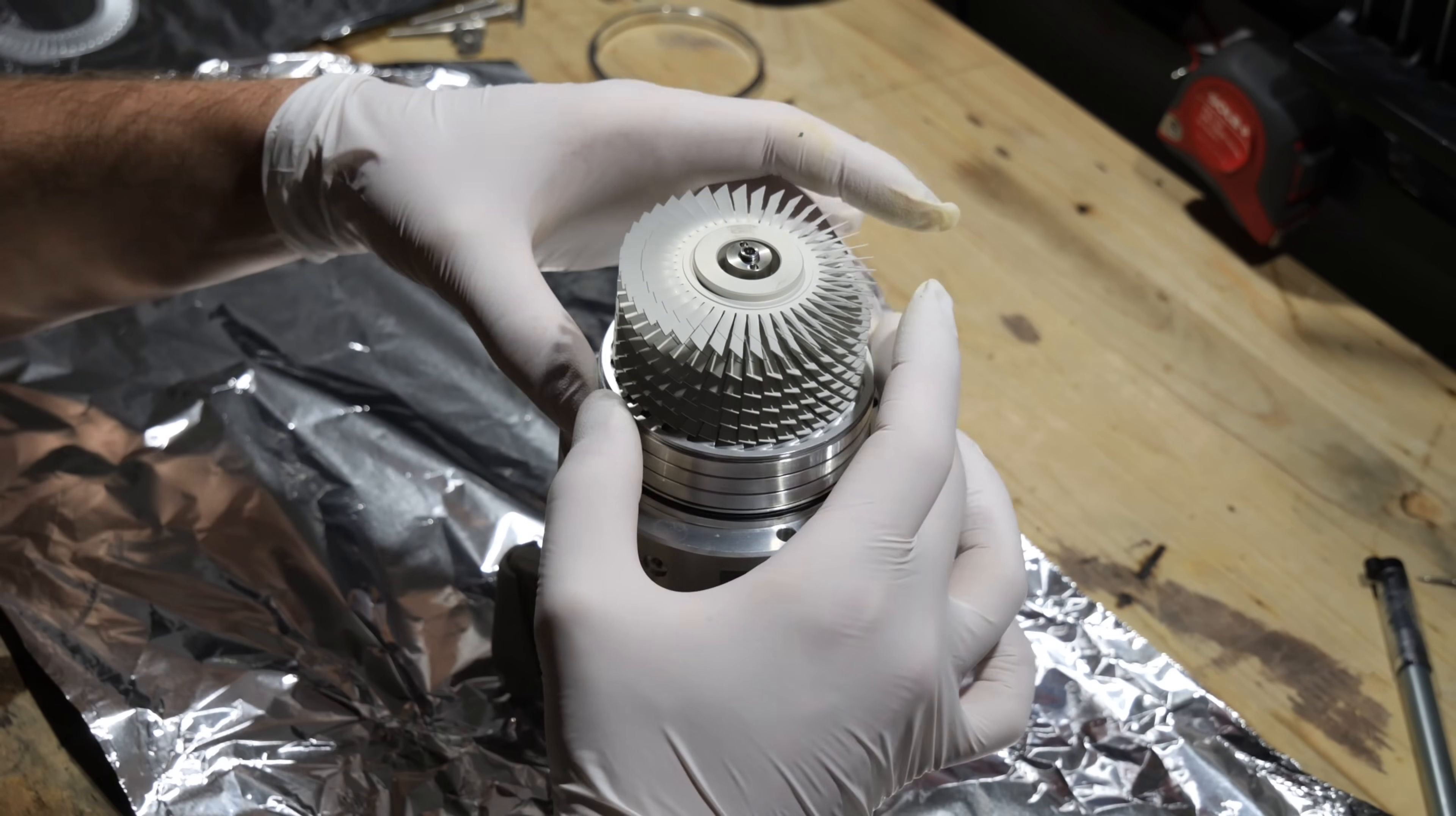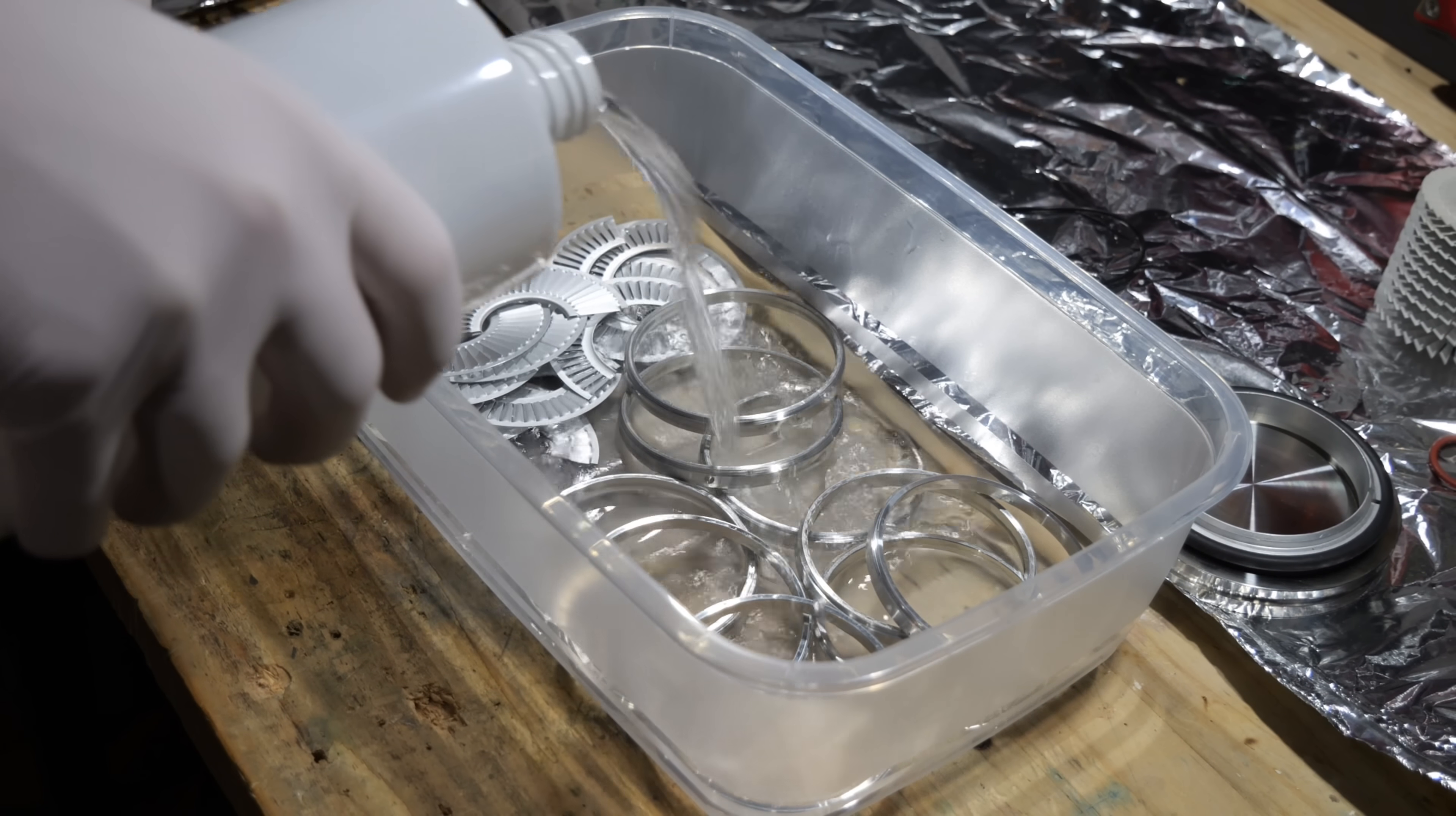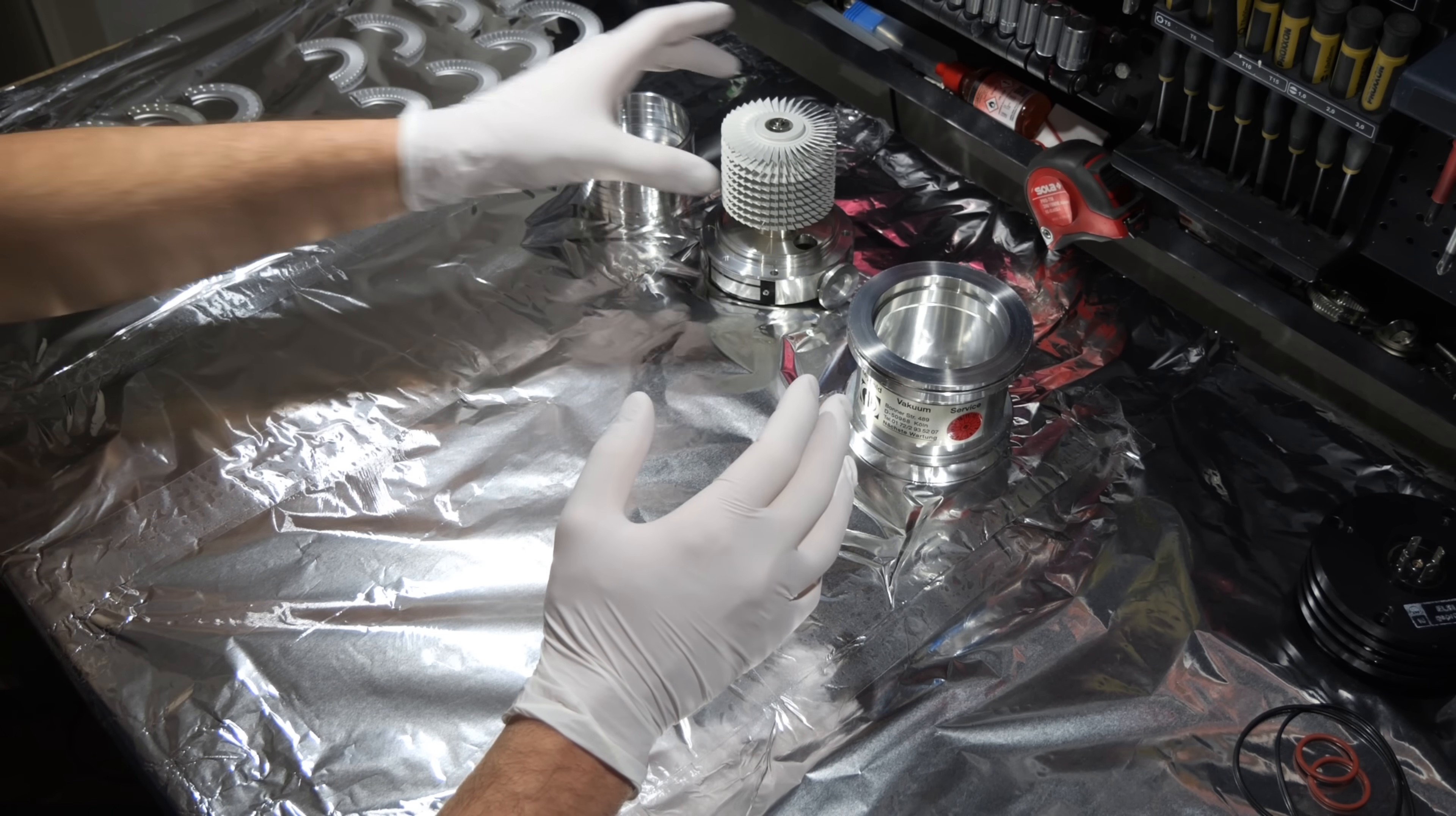I completely disassembled the pump and cleaned all the components with petroleum ether, isopropyl alcohol and subsequently distilled water. With everything thoroughly cleaned it's time to reassemble the pump.